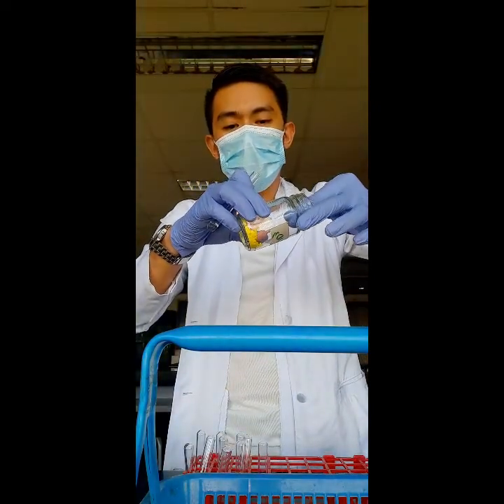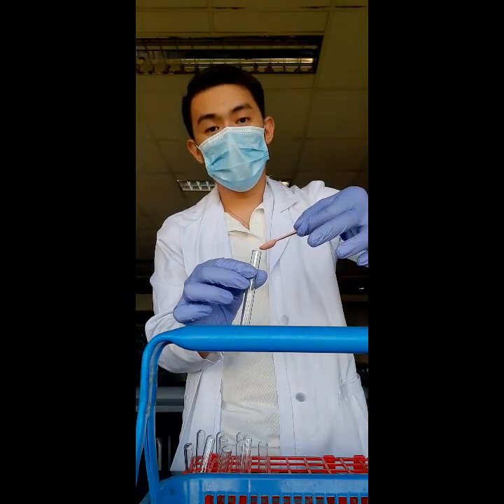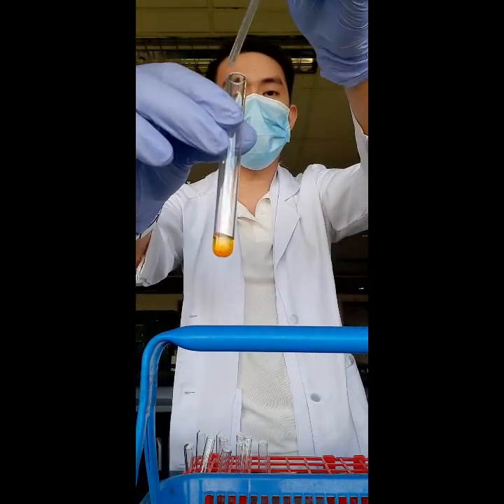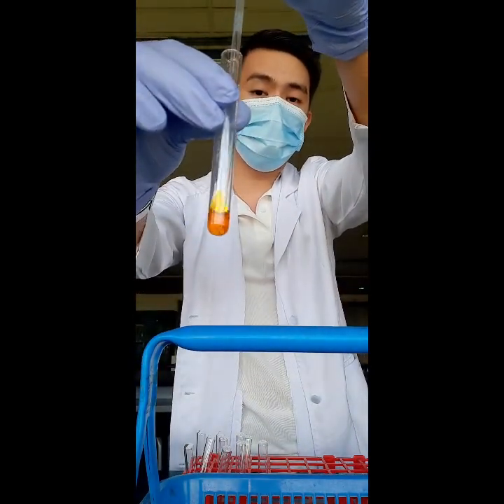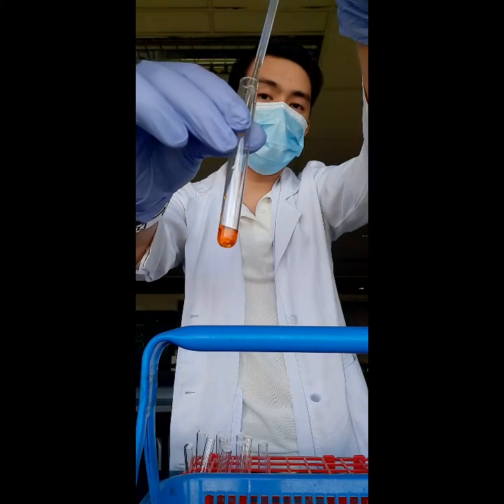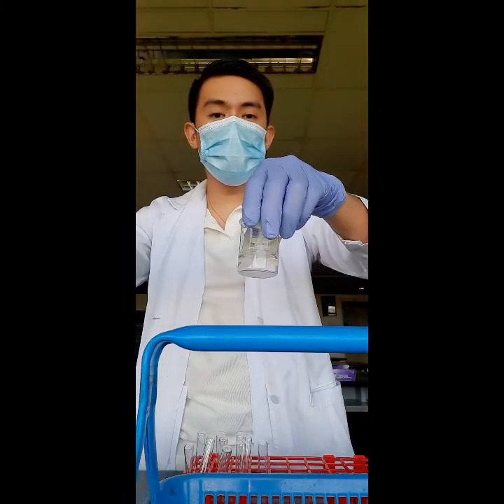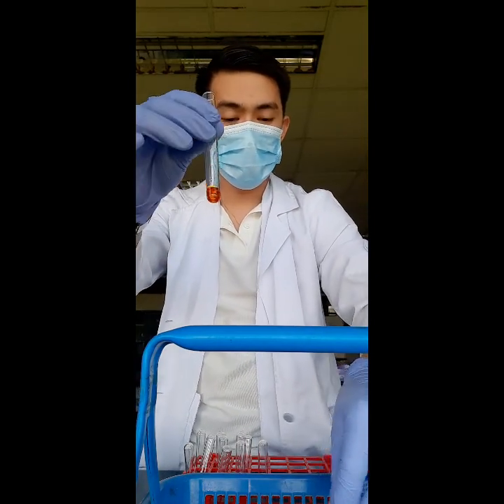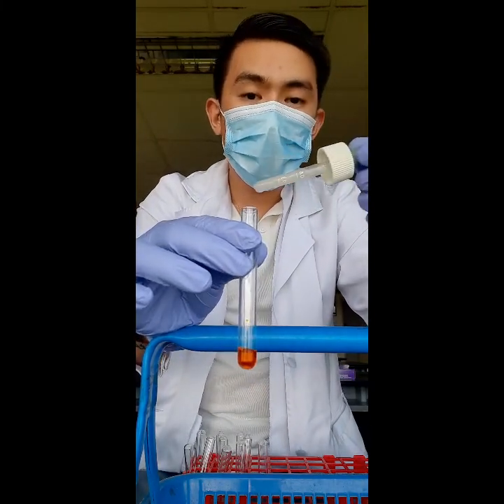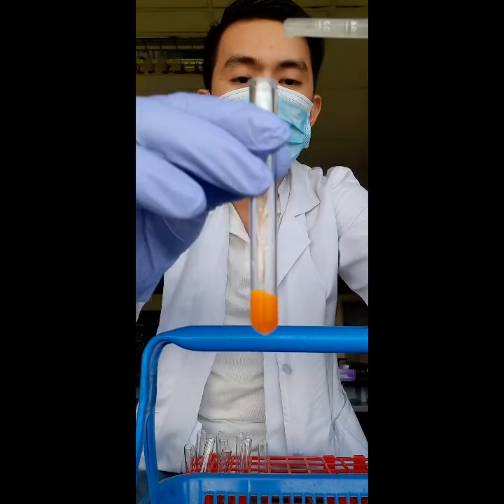That is approximately a pea size. Then add it to our solution. After that, we mix. Here is our anion — we add 10 drops of our anion. If you can notice in the solution, there is vigorous effervescence, or the appearance of bubbles.